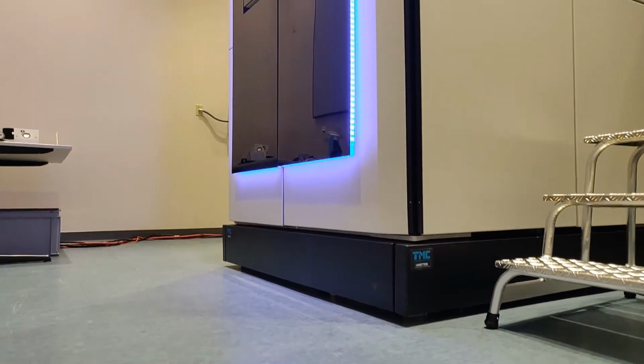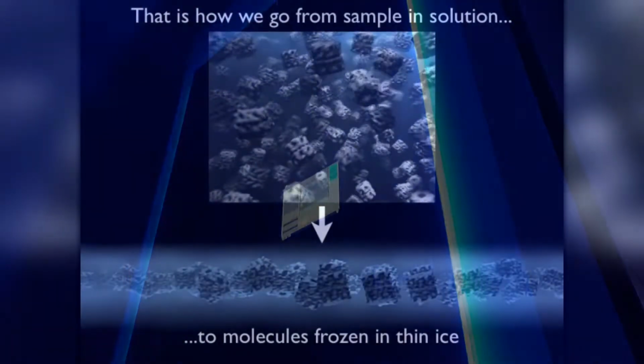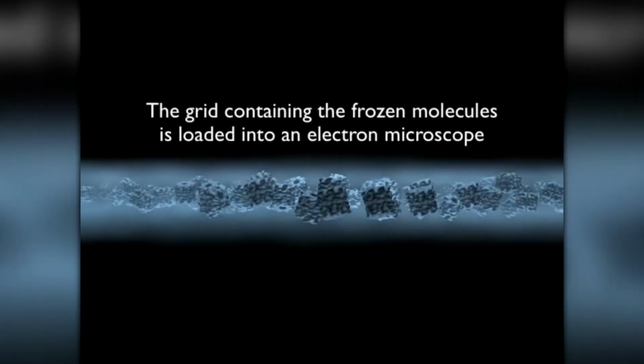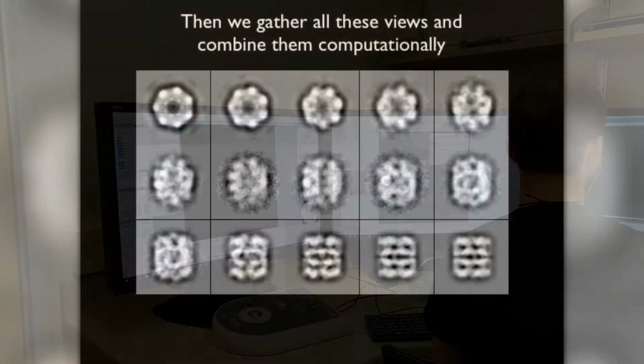This is the Titan Krios, a state-of-the-art electron microscope. Grids are mounted here after being frozen. The electron microscope then images these grids to acquire 2D views of our protein in all different orientations. Using computational software, we can use thousands of these images to reconstruct a 3-dimensional view of our protein of interest.